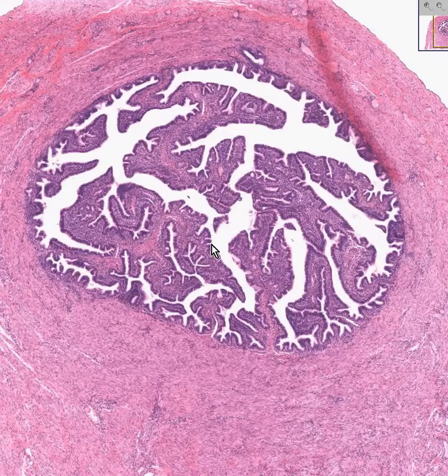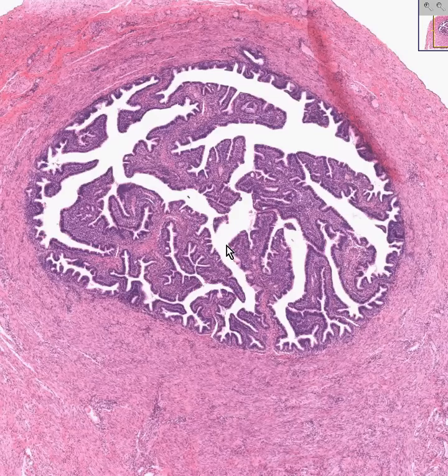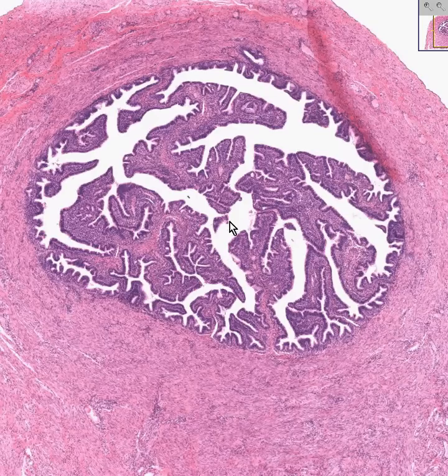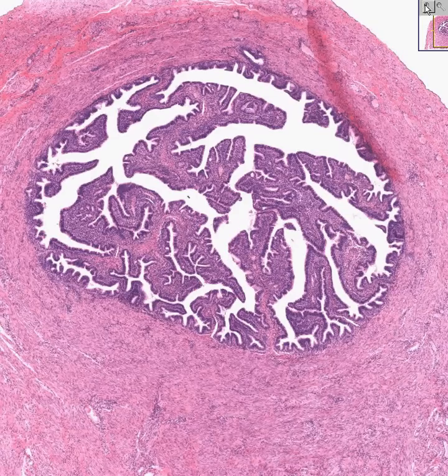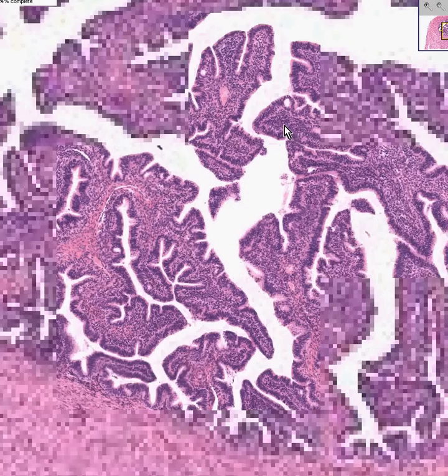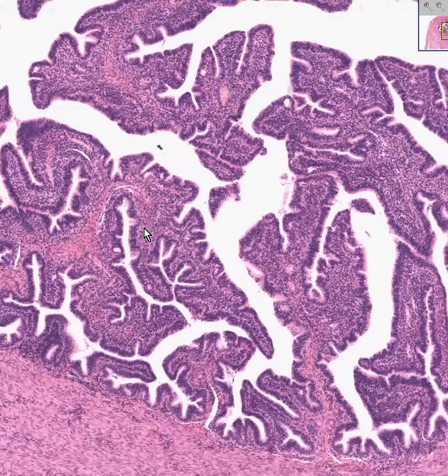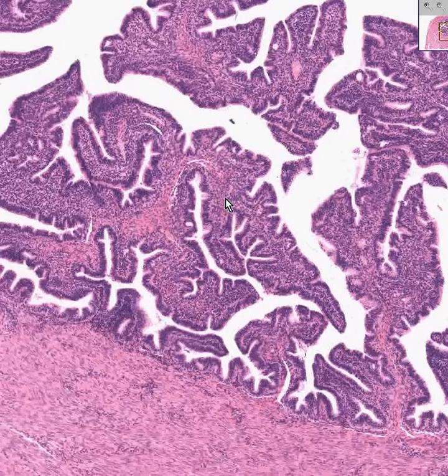And then where it enters the uterus, it actually looks like just a small dilated cystic space within the myometrium, or the muscle of the uterus. This is the ampulla portion of the fallopian tube — the area where fertilization takes place.